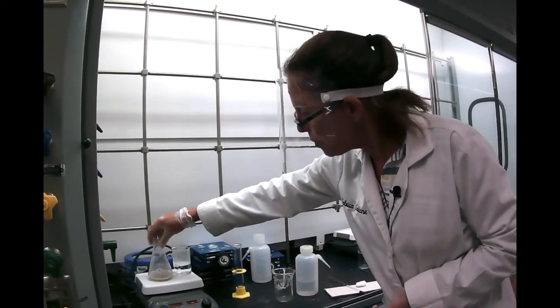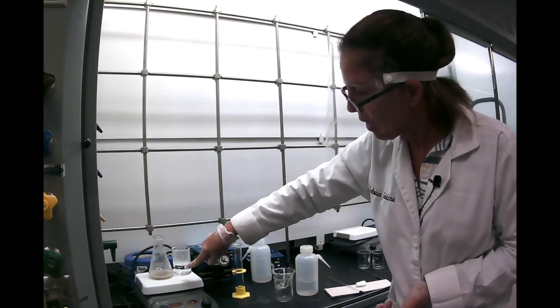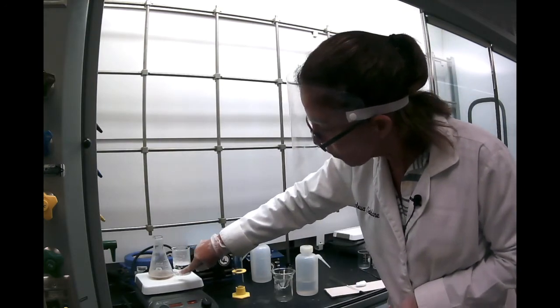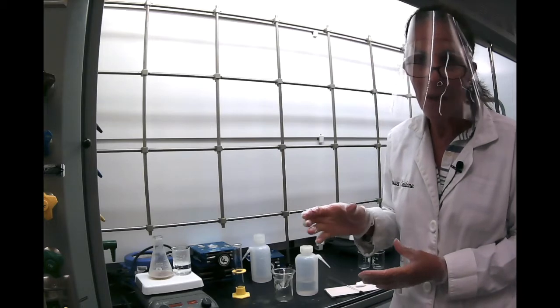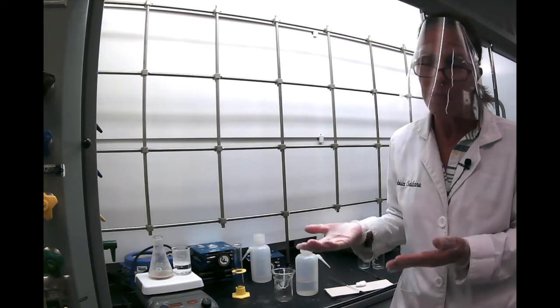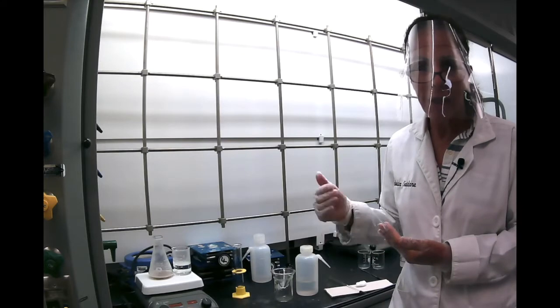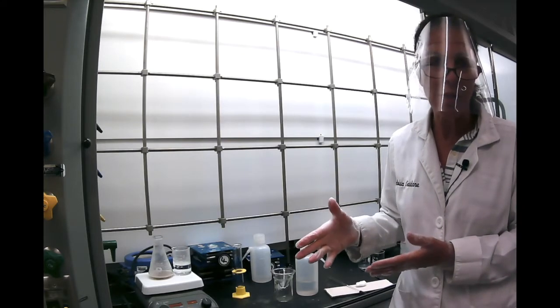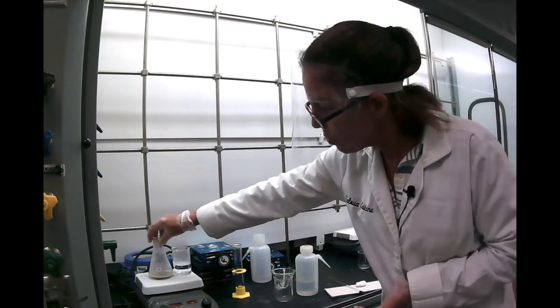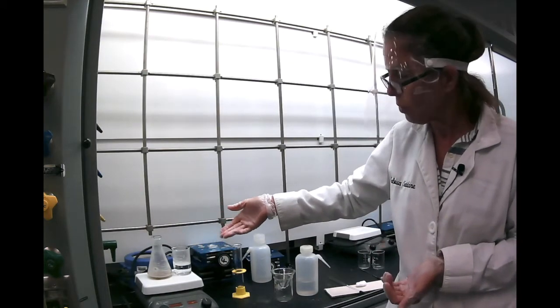So what you do is put it on the hot plate and keep swirling a little bit at a time, and you can tell that this acetanilide is pretty dirty. We were a little conservative about the amount. You really cannot tell how much solvent you should add at the beginning because it all depends on how much impurity. So it's always a good idea to put less solvent and add as you go than put too much and not know how to take it out or wait until you evaporate it. So here 20 milliliters looks like a good amount because it's not dissolving when it's cold.